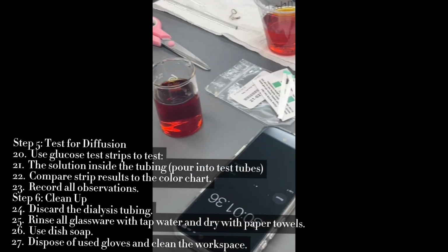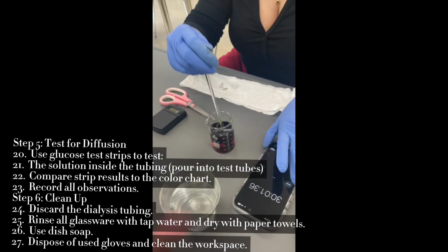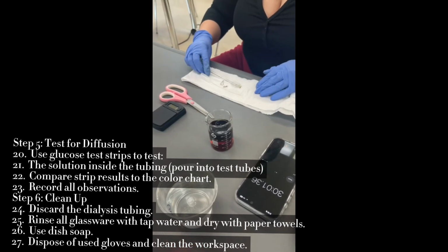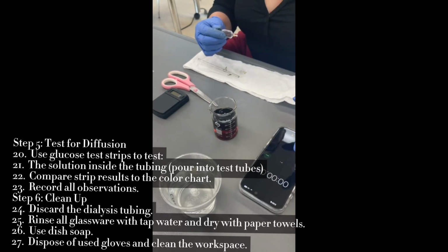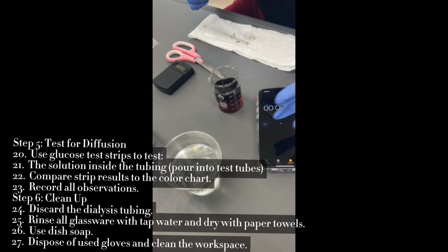Step 6. After 30 minutes, we notice color changes. The glucose solution turned yellowish brown. The starch solution turned dark purple blue after reacting with iodine. And the distilled water changed to orange yellow. We also reweighed the tubing to see if its mass changed.